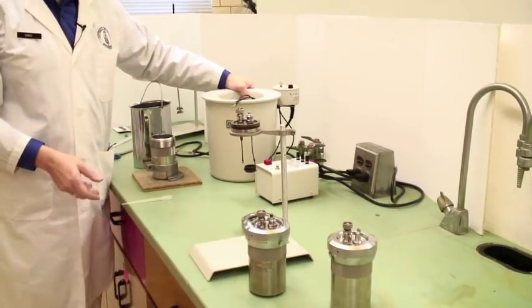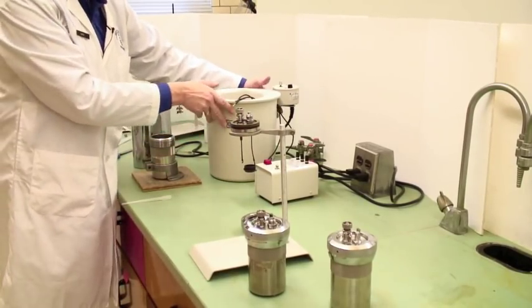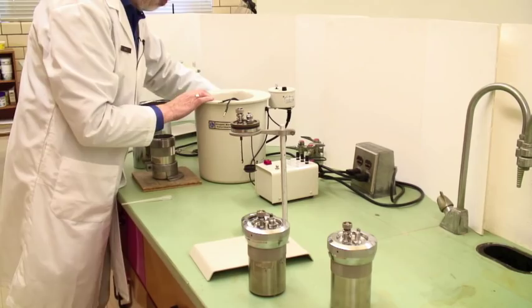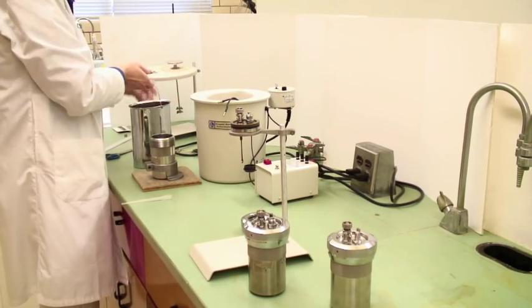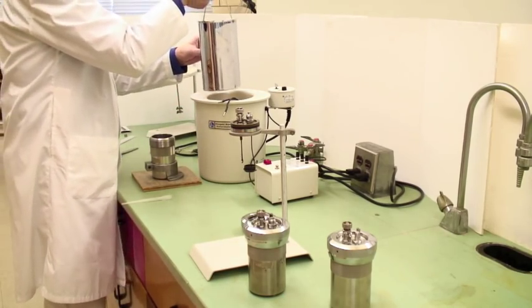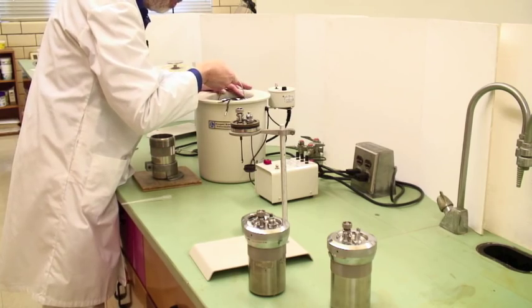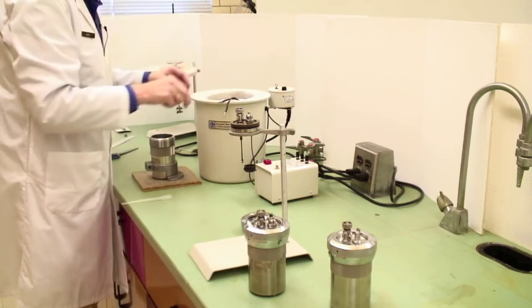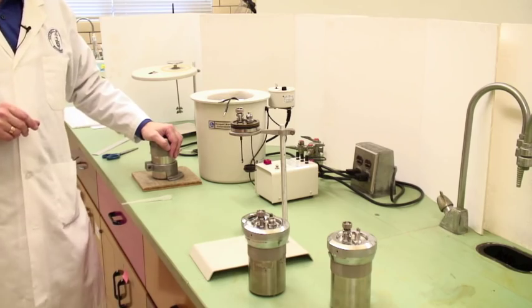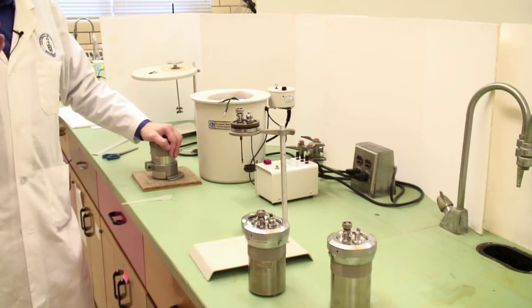The actual calorimeter itself is just an insulated jacket. Inside here we have three studs on which this stands, so there's in fact only one way that this fits. We'll leave that for the moment. Our next task is to actually charge the bomb.